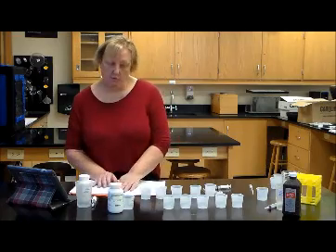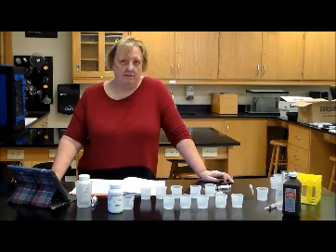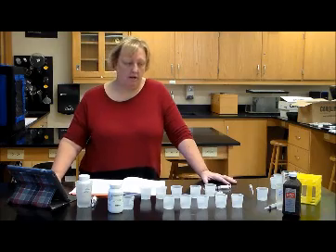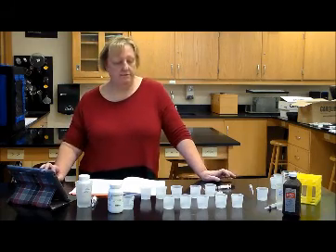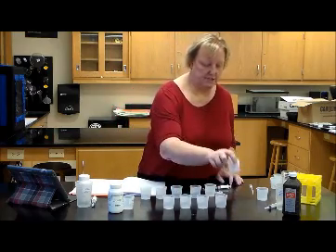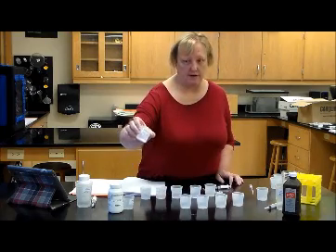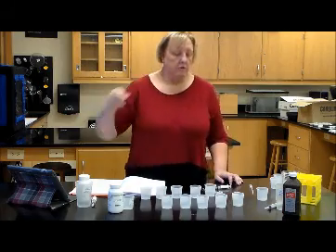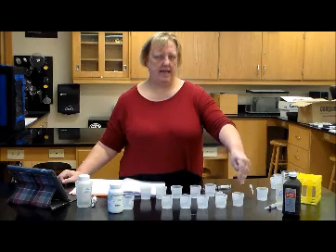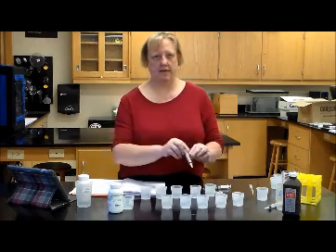Activity D is the one where you'll be doing most of the work, and this is probably the most complicated of all of them. So please make sure that you're paying attention to what's going on in this procedure. The first thing you're going to do is you're going to have these 5 cups. The cups are labeled with seconds on them. We have 10 seconds, 30 seconds, 60, 120, up to 180 seconds. You're going to put hydrogen peroxide in, then you're going to add catalase. You're going to wait 10 seconds and put in sulfuric acid.